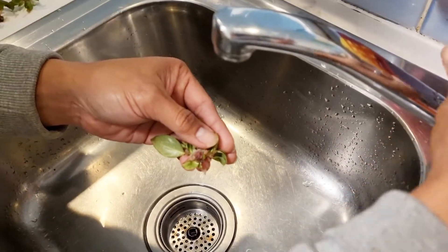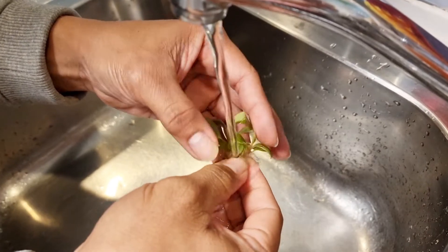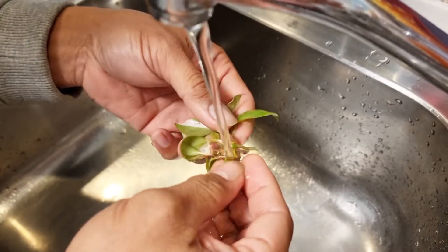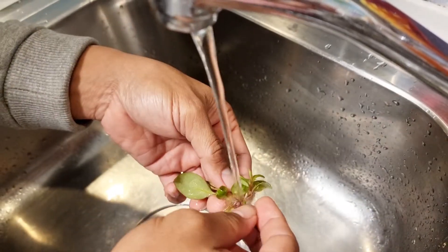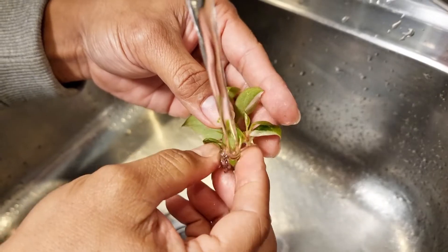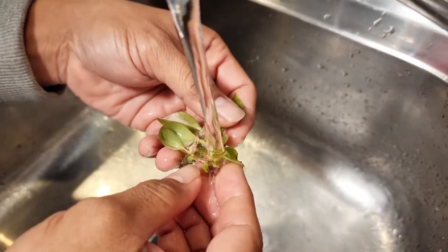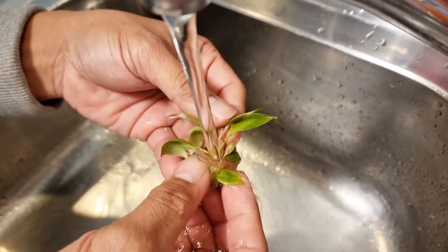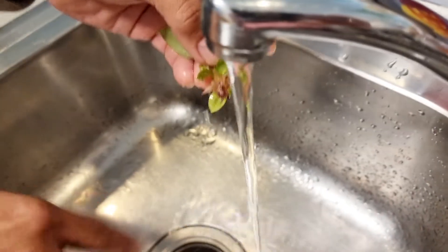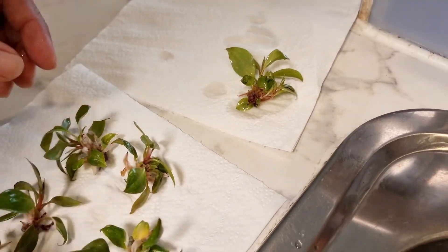Get your running water — gentle running water — and just wash it. If you've got dried leaves in there, this is the best time to remove them and gently brush off the gel media from the root area. With a cluster, we recommend leaving the small plantlets together, because separating them at such a small, young stage gives a very slim chance for them to grow. Once the media is mostly all gone, put them in a dry paper towel and continue with the rest of the batch.